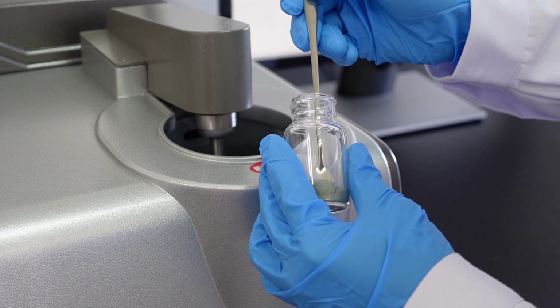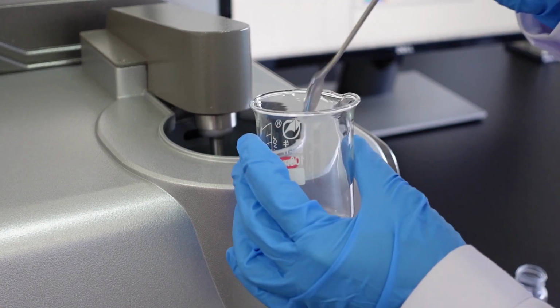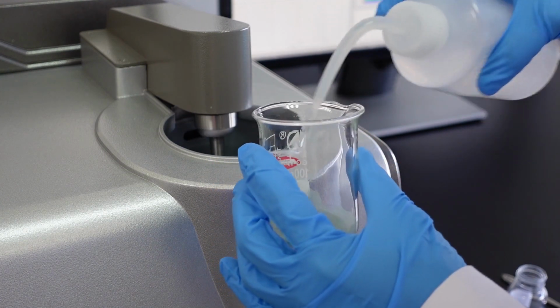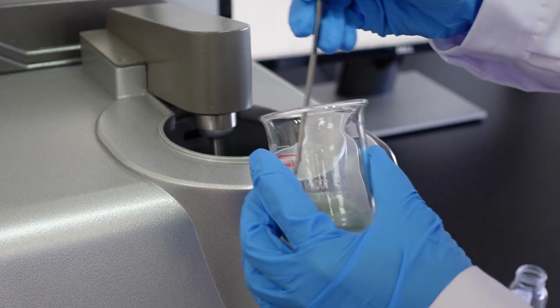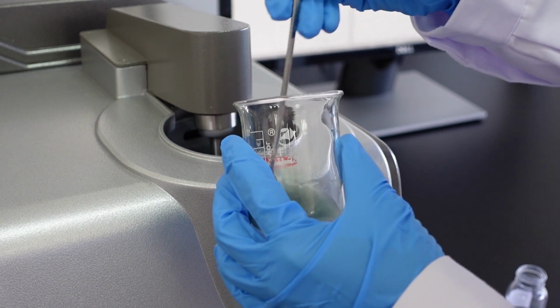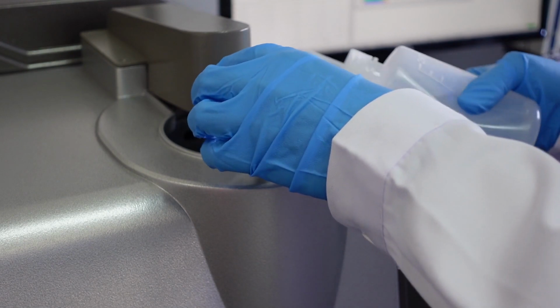A laser analyzer provides the particle size distribution of powders by measuring only a small fraction of samples. Therefore, the sample to be measured should be sufficiently representative, which is strongly related to the sampling method. Here, I use a small spoon to sample and pre-disperse it into the water in the beaker, and make sure that it's well dispersed in the water. Then I pour it directly into the circulation system, and please keep in mind to pour all the sample in the beaker without any part remaining.